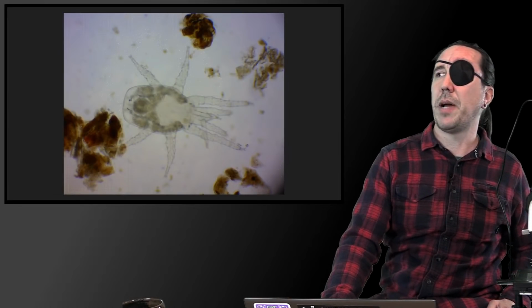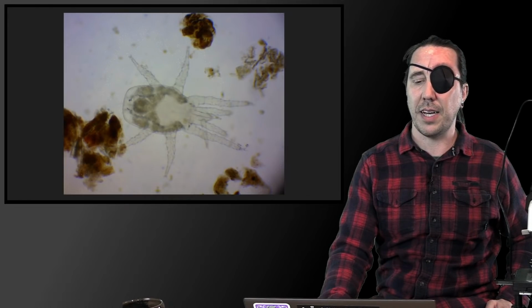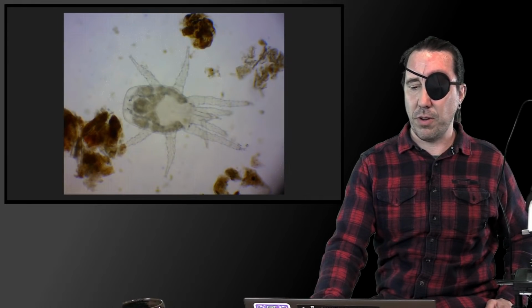And then I've got a picture of a microarthropod. This is a good capture. It's hard to capture microarthropods and you don't see them a lot, or you might actually see just little parts of microarthropods that have gotten ripped apart in the soil.